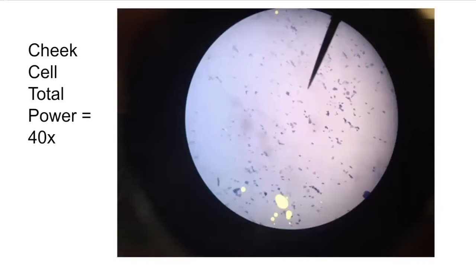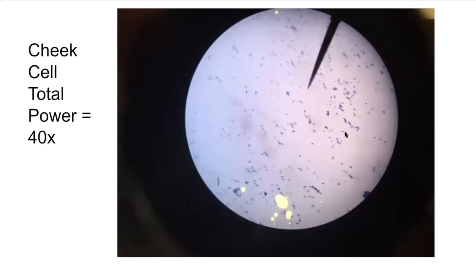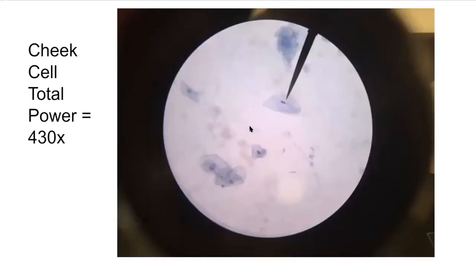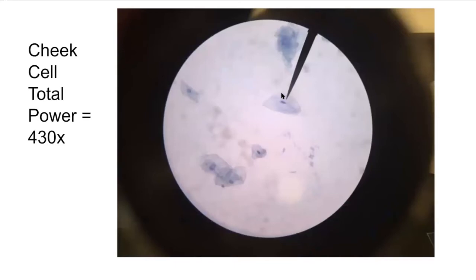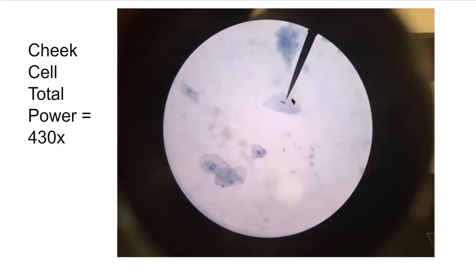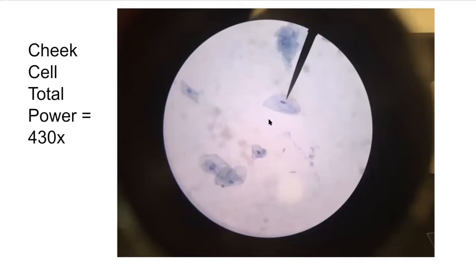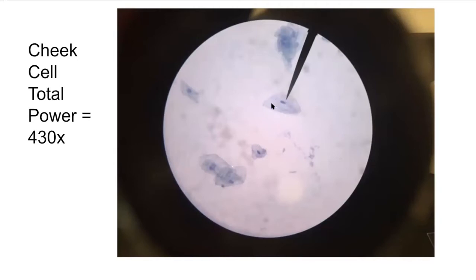If we look at our cheek cells on low power, each one of these little blue dots is a cheek cell. As we increase power, we start to see the nuclei. At even higher power, you're able to see the nucleus and the plasma membrane in pretty good detail. Animal cells do not have a cell wall, so there's no outer coating — which is why they have lots of different shapes. We can also see the cytoplasm inside of the cell.